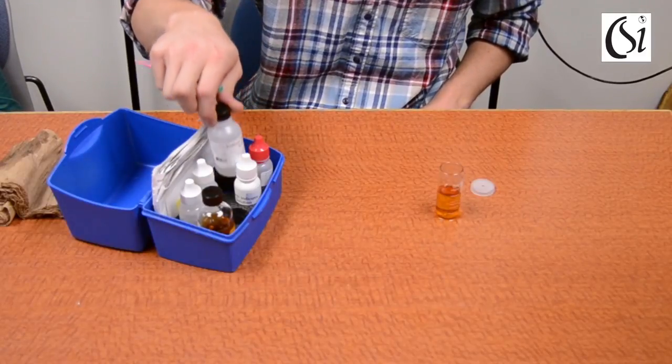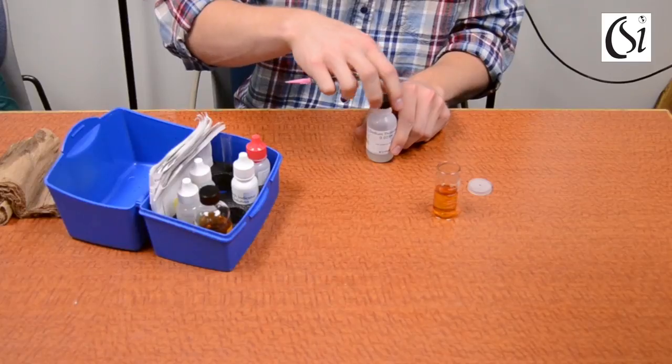Fill the titrator plunger with sodium thiosulfate solution.